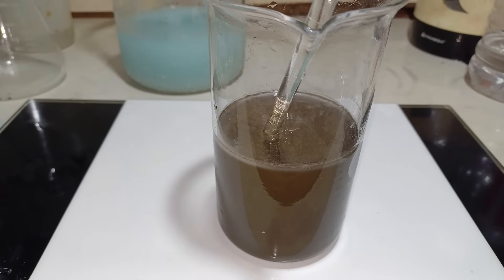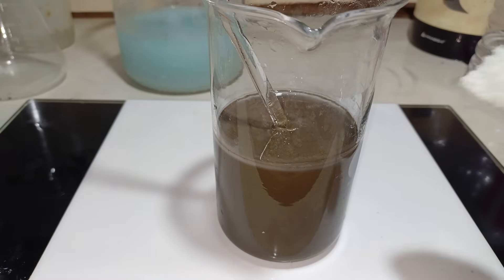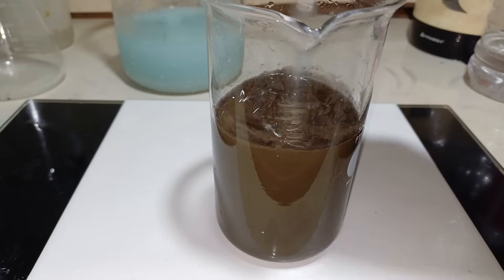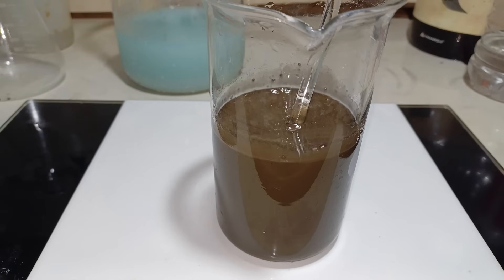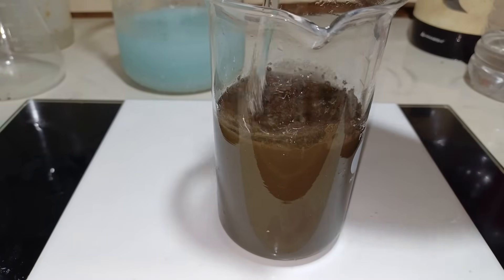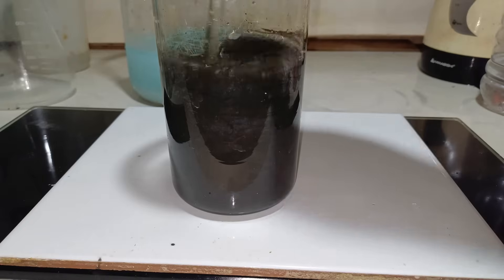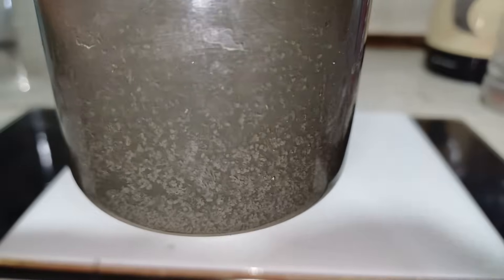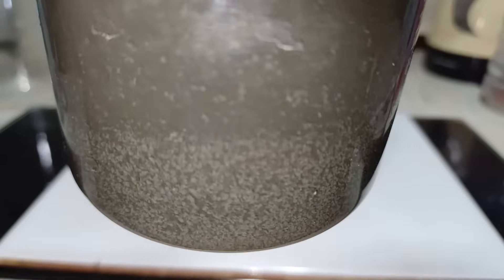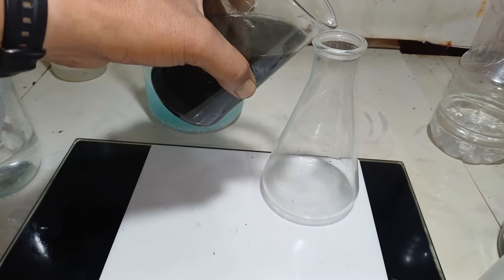Now the silver chloride has been converted to silver oxide. At this time we convert it into silver metal by adding sucrose — white sugar. This takes time as well. After 15 minutes of stirring, that's exactly what we're looking for. There are some large particles — we need to stir more. Our silver oxide has converted to pure silver metal. We now wash with hot distilled water.